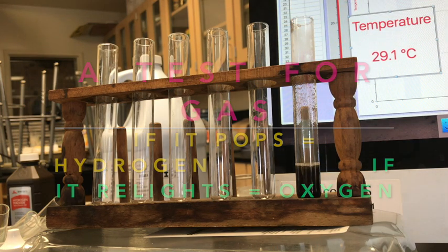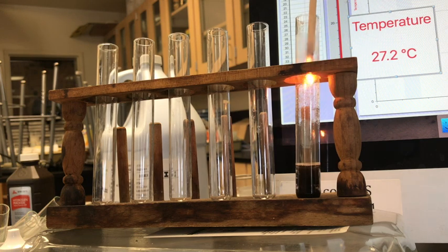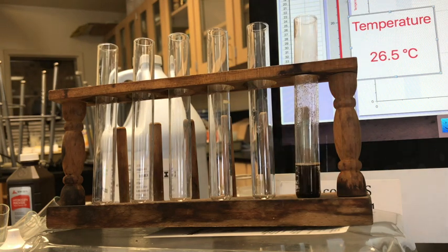And so we changed the hydrogen peroxide into water, you saw the steam, and oxygen, which is characteristic, like it's helping my fire relight inside there because I have oxygen available. Nice. Experiment number 1, done.